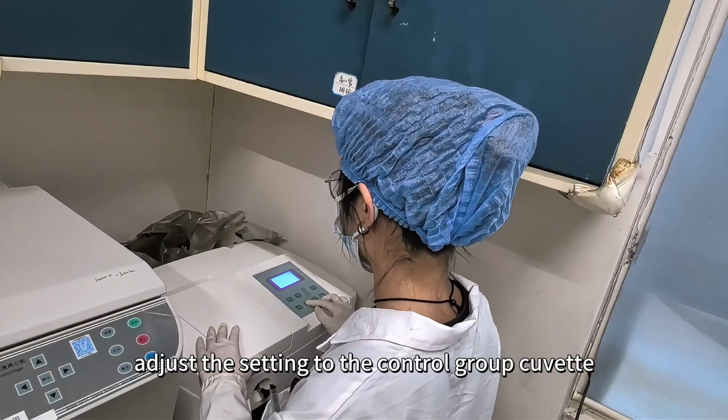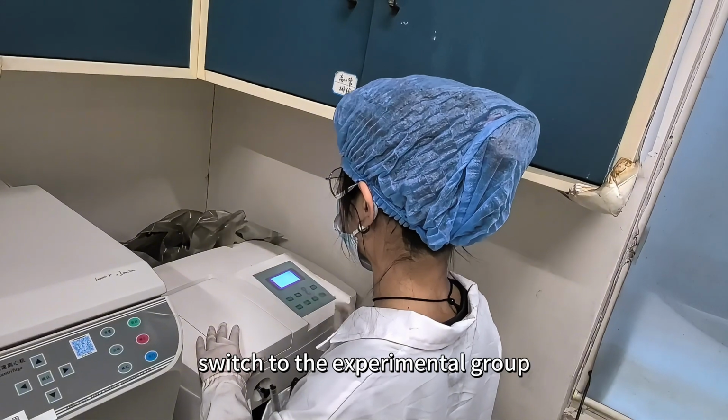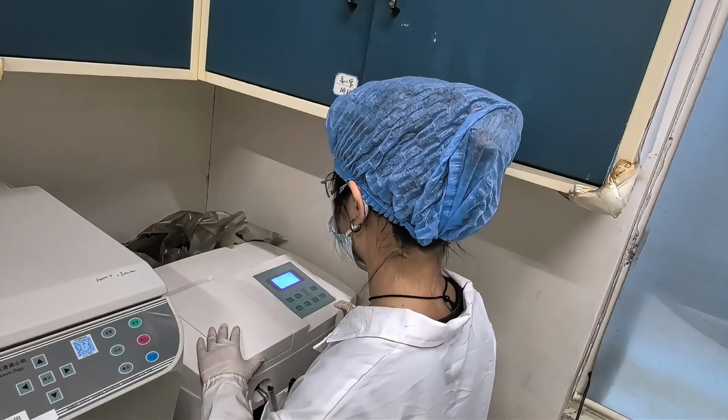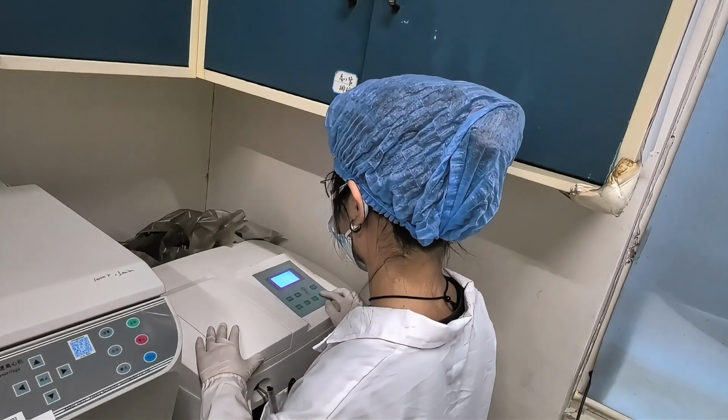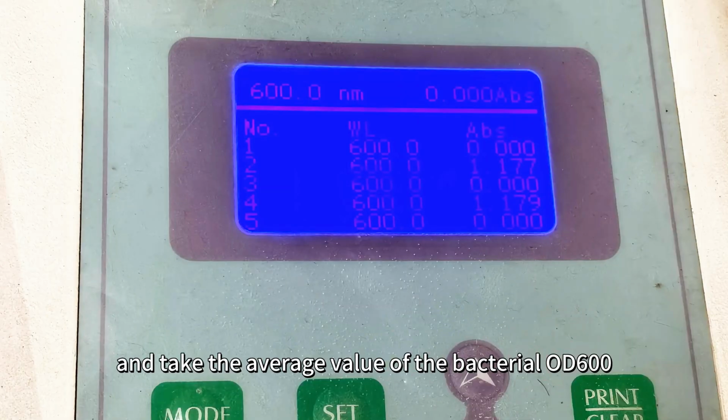First, adjust the setting to the control group cuvette and set the absorbance to 0. Then, switch to the experimental group and read the absorbance value on the display, which represents the bacterial OD600. Repeat the above steps 3 times and take the average value of the bacterial OD600.